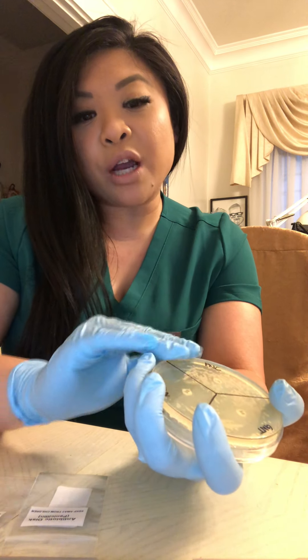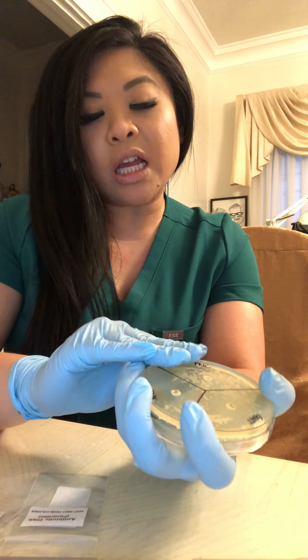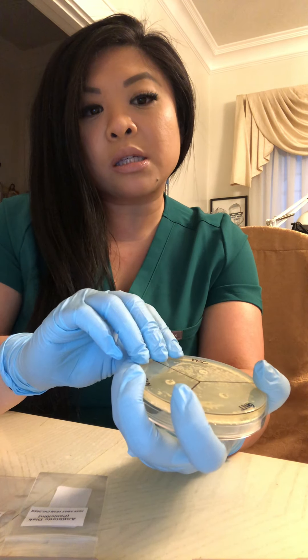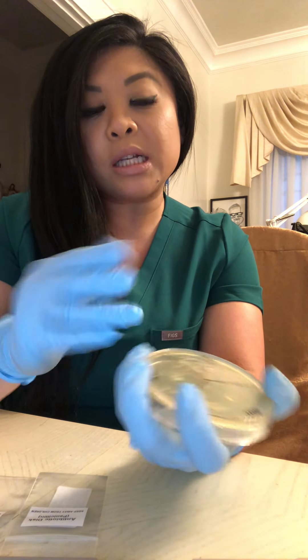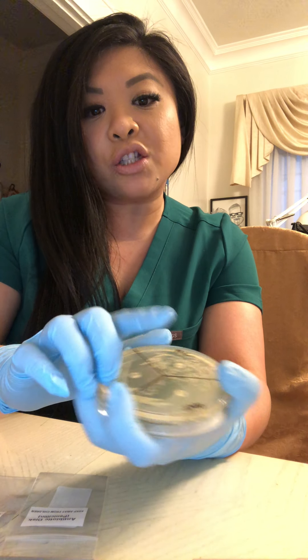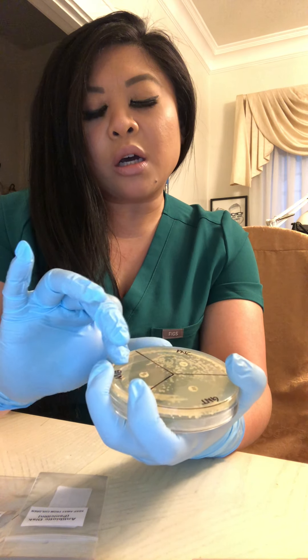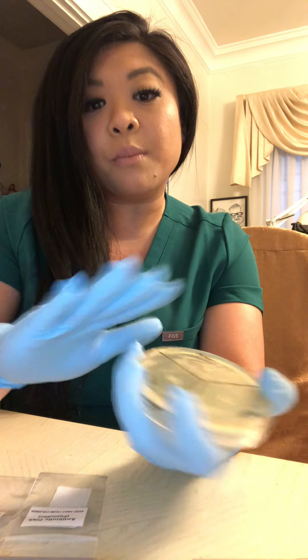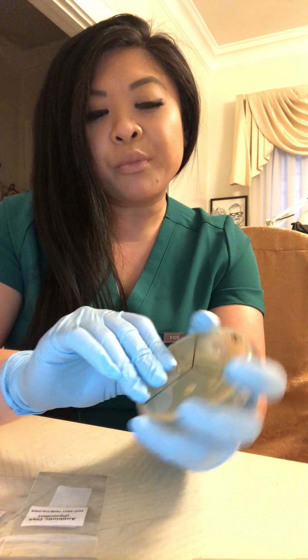I learned that penicillin is very effective in stopping Staphylococcus epidermidis, and that novobiocin and gentamicin also do a great job in stopping the spread of the bacteria.